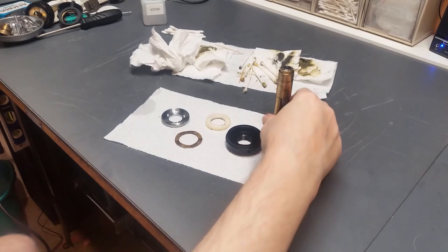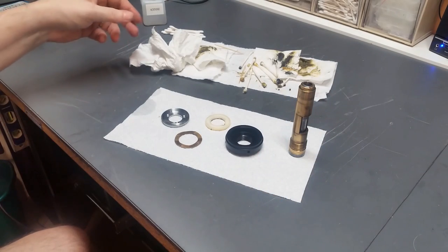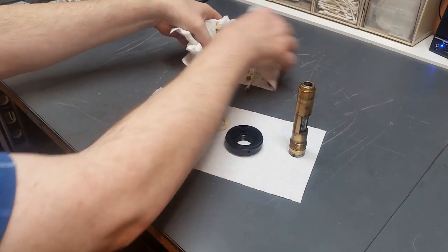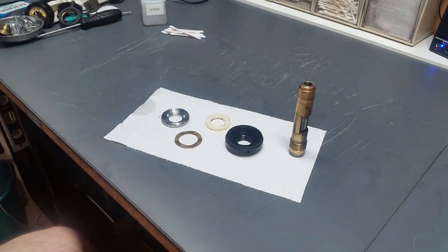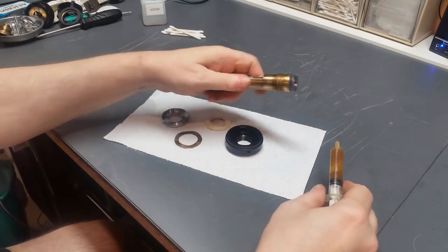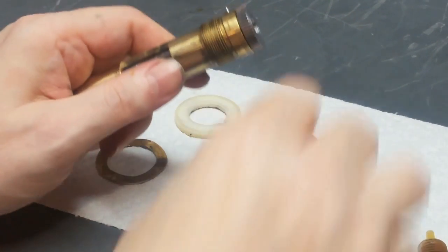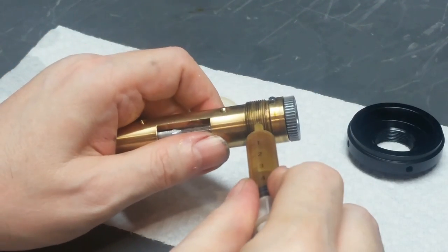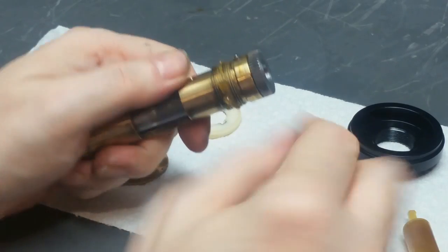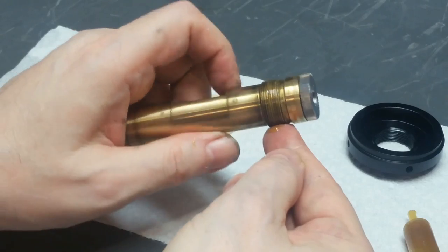Okay, a lot of time has elapsed, a lot of mess, as you can see. These parts are clean now, so we're ready to put that all back together. Let me get rid of this disgusting mess. Okay, start out with, see if I can take you in a little closer. I'm going to put a little Plastilube brake grease throughout the threads on this thing.